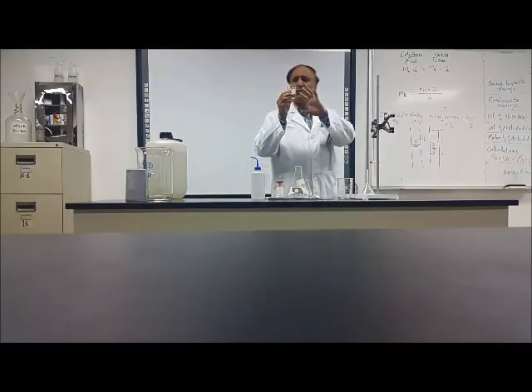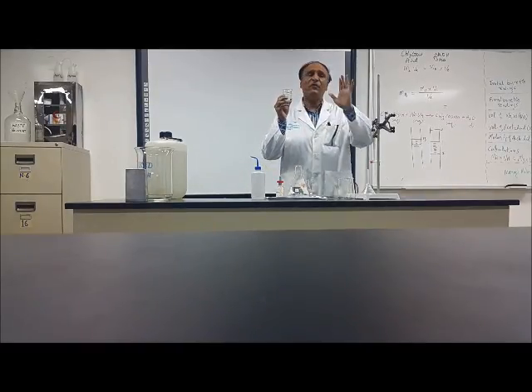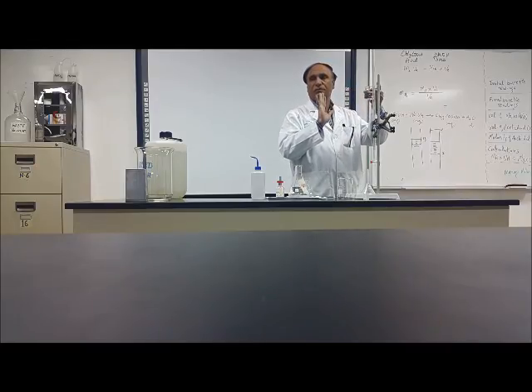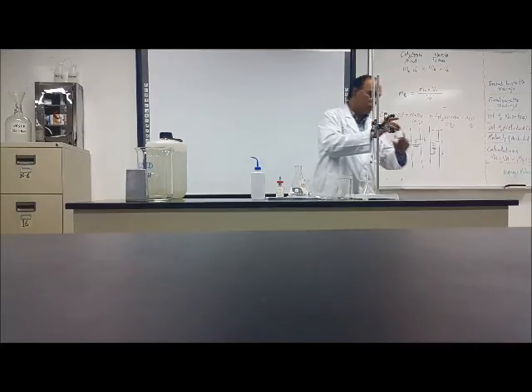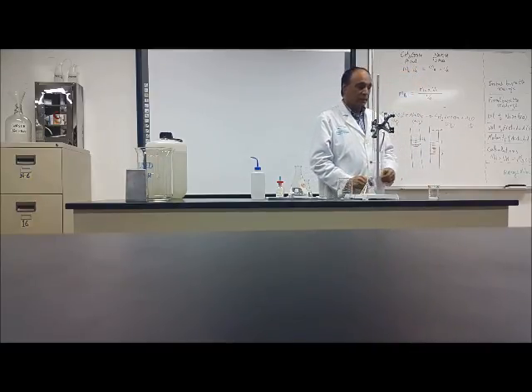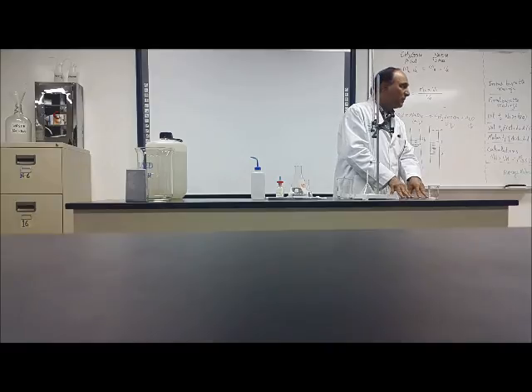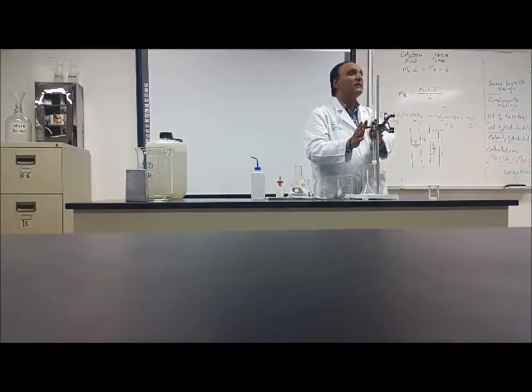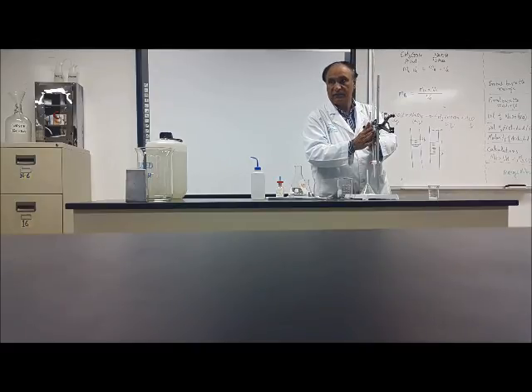You will see that this amount is too much. When I finish the experiment, you will see that more than half will not be used. So this is sodium hydroxide, put it on one side. This student who took the sodium hydroxide will fill the burette. I will tell you how to fill the burette.